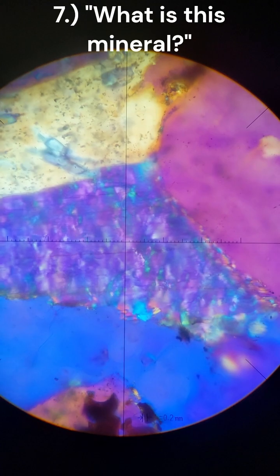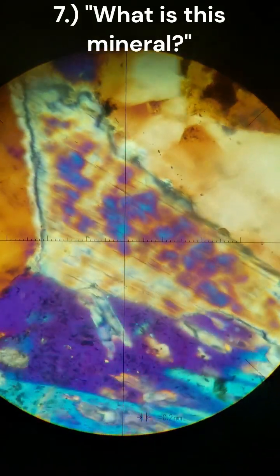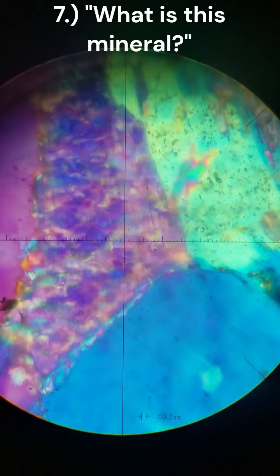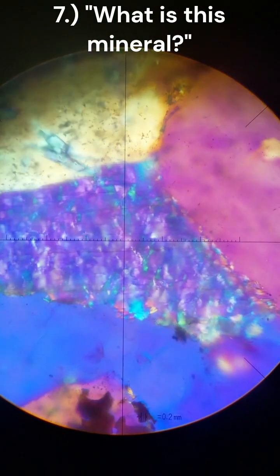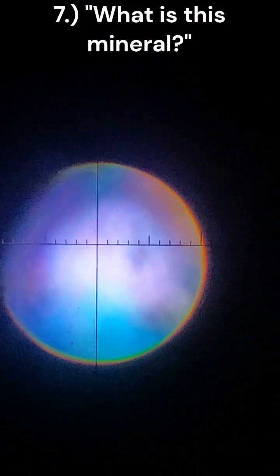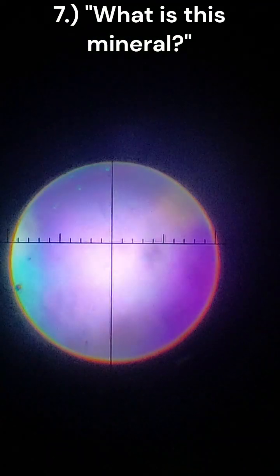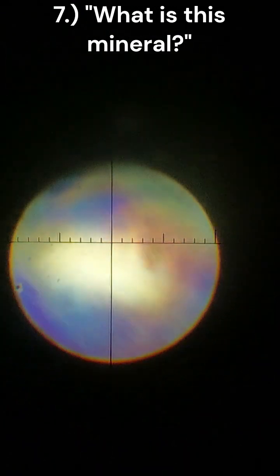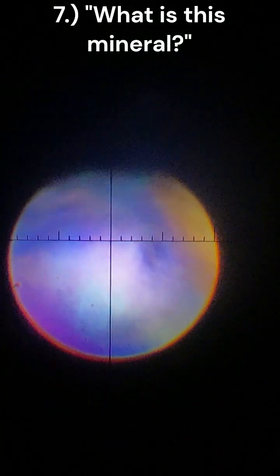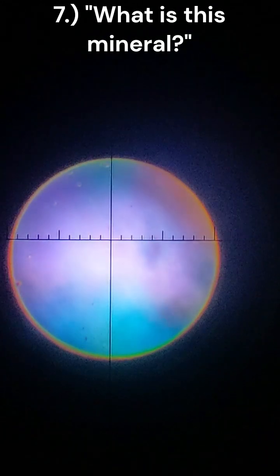Gypsum for interference colors. 90 degrees counterclockwise. 180 degrees. Going to 270 degrees. Finally back to 0 degrees. On Bertrand lens. Let's see if I can zoom in. Mineral's kind of messy, so not really getting much, but that would be a full 360 rotation. No clue what that is.